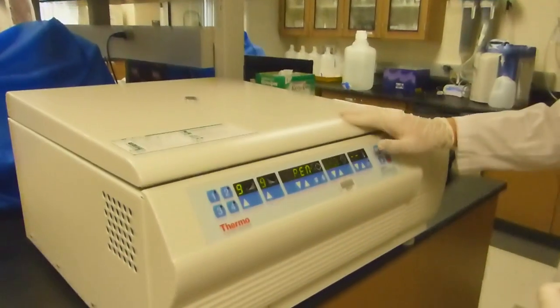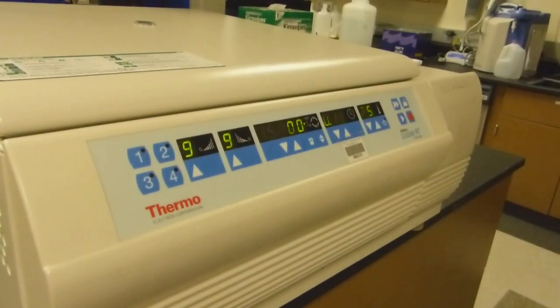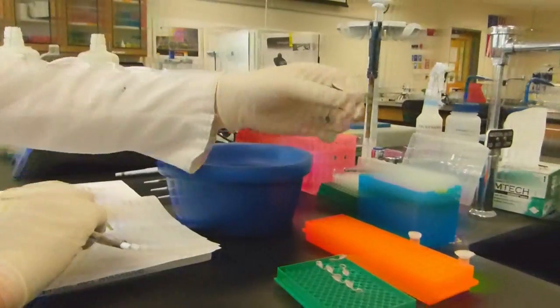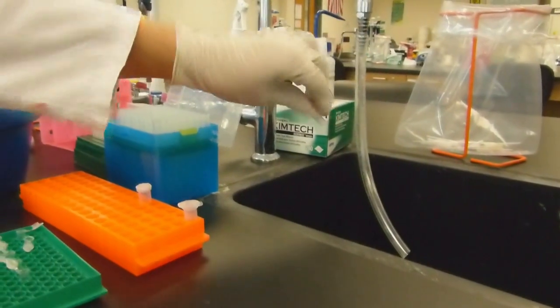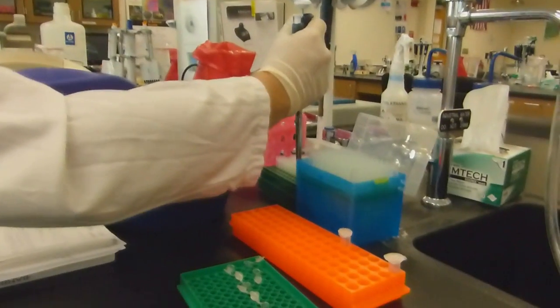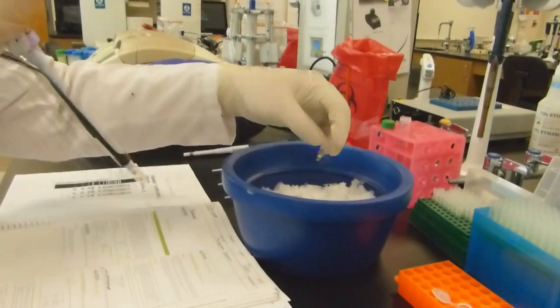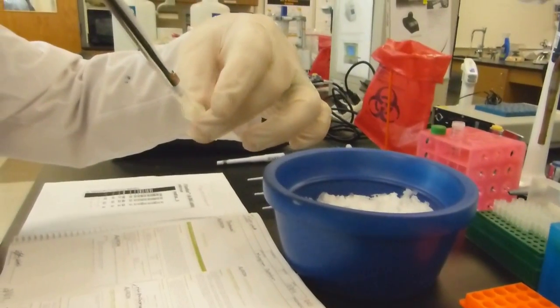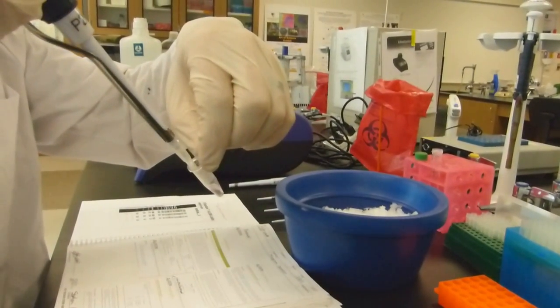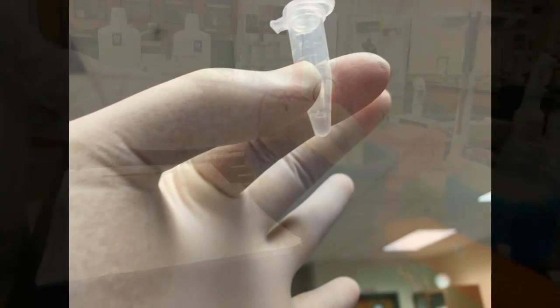Place the sample or samples you are working with into the large tabletop centrifuge and set the centrifuge for 15,000 times G and a runtime of 10 minutes. Any nucleic acids will be pelletized, adhering to the wall of the tube, so you may decant the supernatant by inverting the tube. Set your micropipette to 50 microliters. A lysis buffer that comes with the kit should be kept on ice. Take 50 microliters of the buffer and resuspend the pellet by pipetting, not by vortexing. The result should be 50 microliters of clear solution for each sample tube that you will be testing.